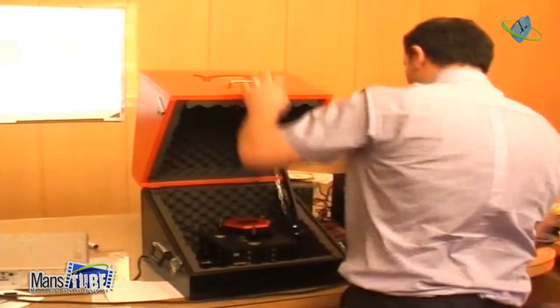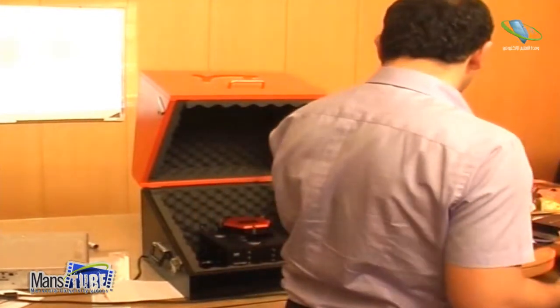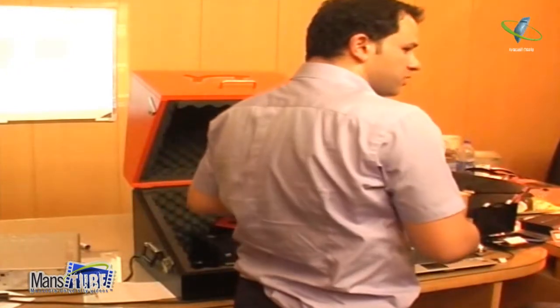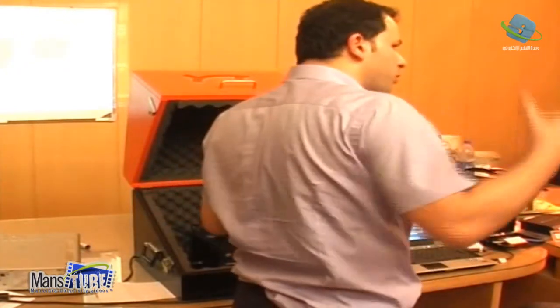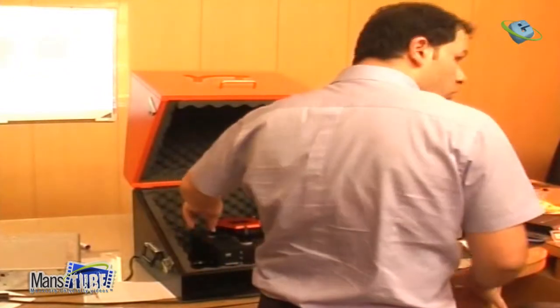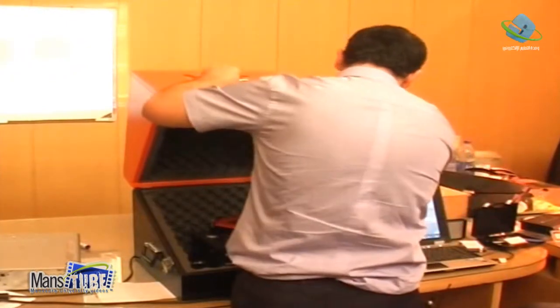So now, usually if you want to work in liquid, you can use any kind of tissue, put it in water, and put it inside, so that the water on the sample will not evaporate very fast. You can put water on some tissues inside, close it here, and they give better humidity.